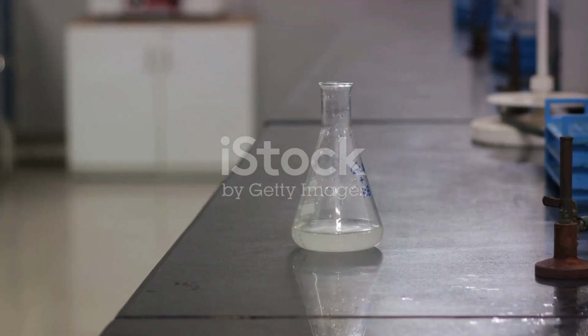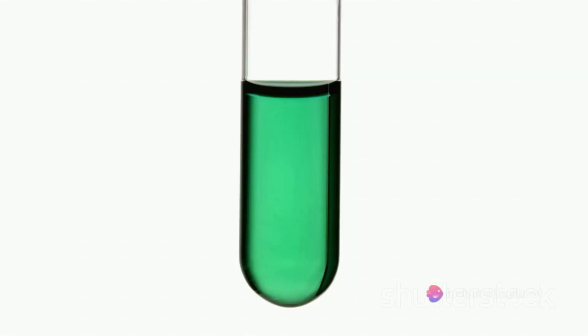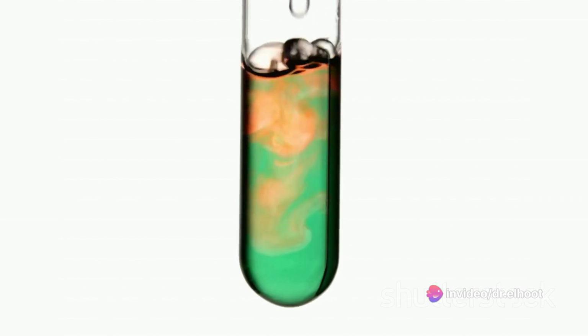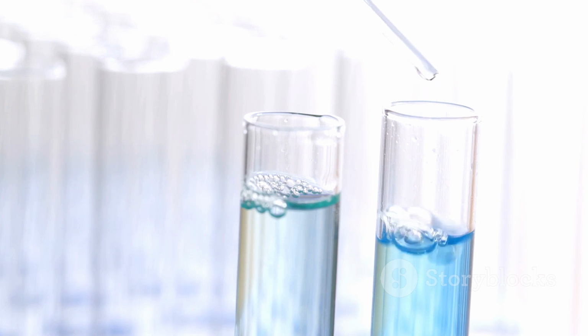The dark wine red color of the solution, courtesy of the EBT indicator, signifies the presence of zinc ions. As you titrate with standard EDTA, the color begins to shift. This color change is your roadmap. When you see a mix of red and blue, it's an indication that you're close to the endpoint. But don't stop there. Continue to titrate until the solution turns pure blue, a clear sign that all zinc ions have been replaced by EDTA and the EBT indicator ions are now free.